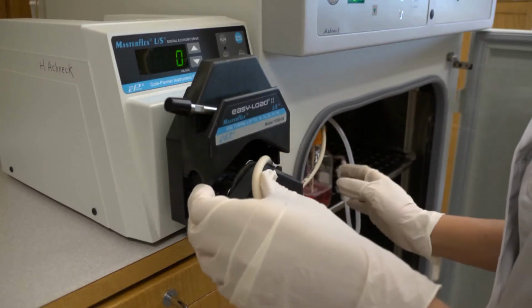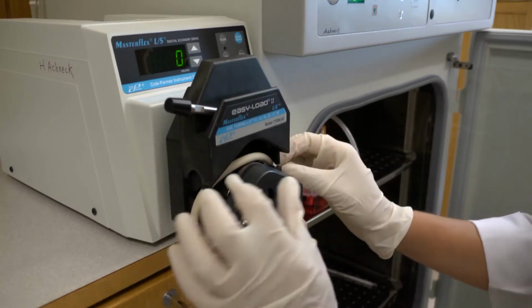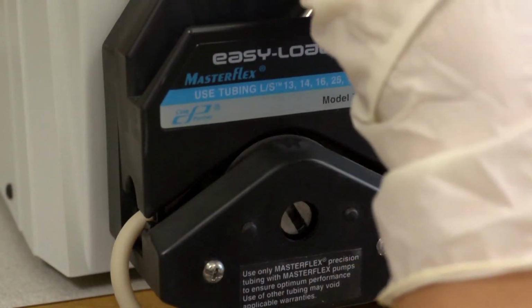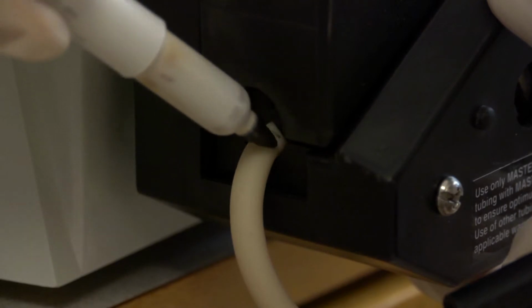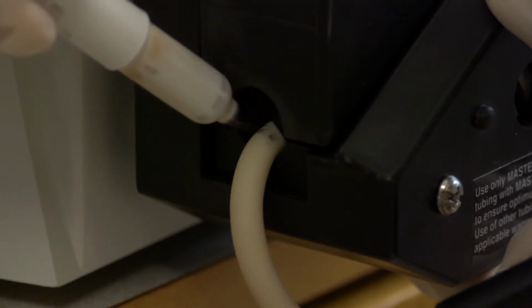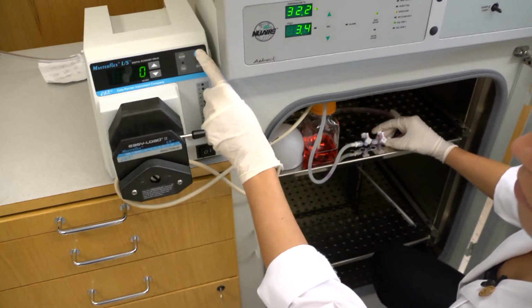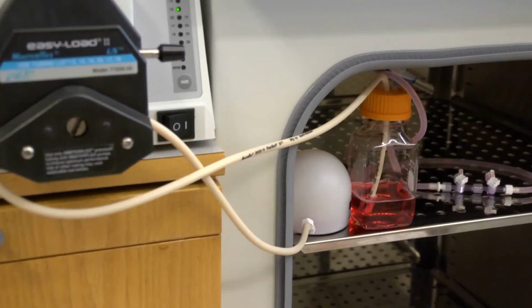Clamp the hard tubing into the Masterflex roller pump head indicated for use with this type of Cole-Parmer tubing. Ensure that the tubing does not overlap with the roller pump mounting tracks. Mark the tubing where it exits the pump head on either side with a marking pen. After ensuring that all stopcocks are closed off towards the sample ports and open along the flow circuit, start the pump. Verify the direction of flow. The perfusate should move from the glass reservoir through the hard tubing into the pulse dampener.